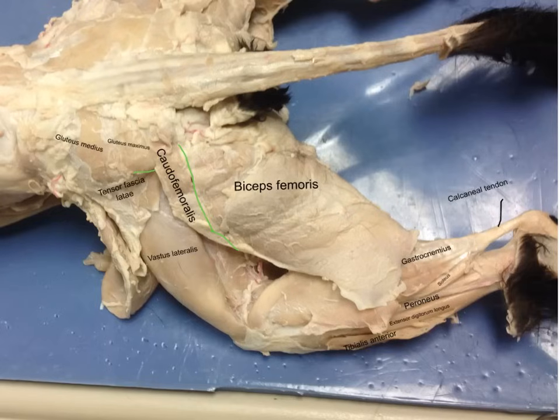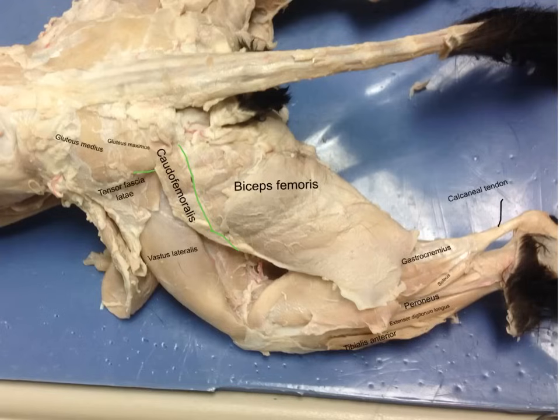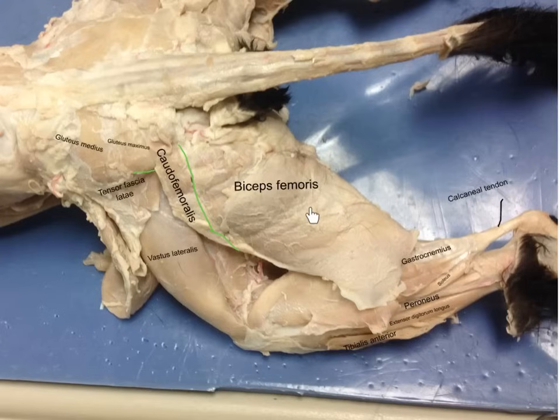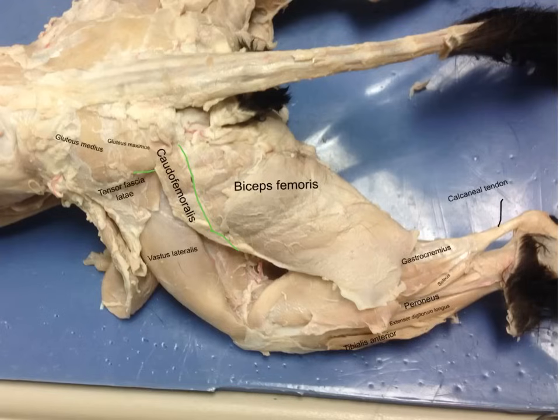Alright, we're going to record the third cat video. Looking at this, we have the biceps femoris, the largest muscle.